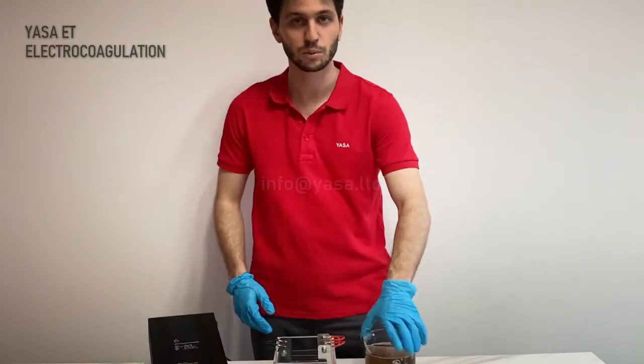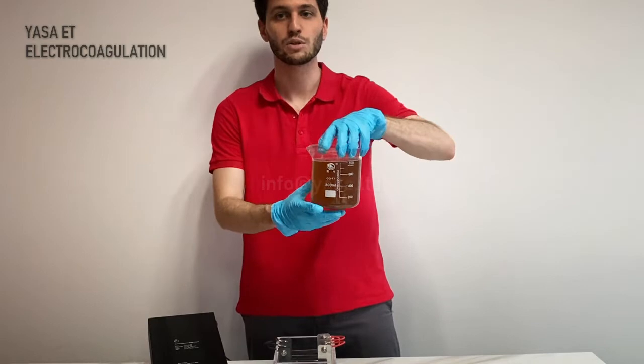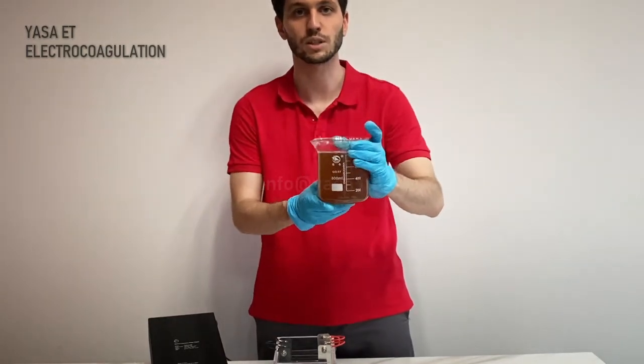This is the wastewater sample we received from the client, and I will show you how to use our equipment for treating this wastewater.